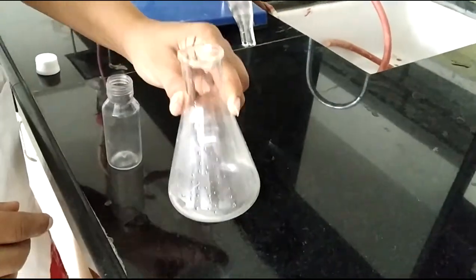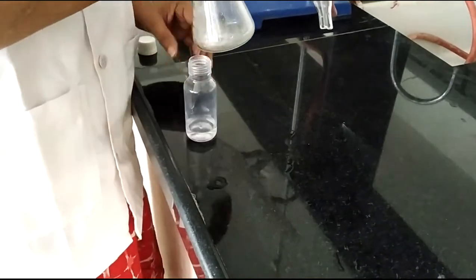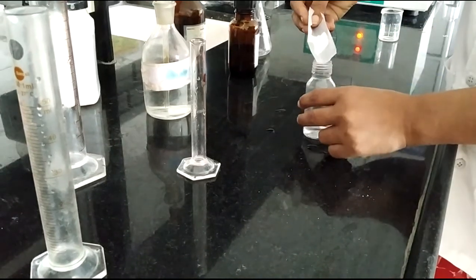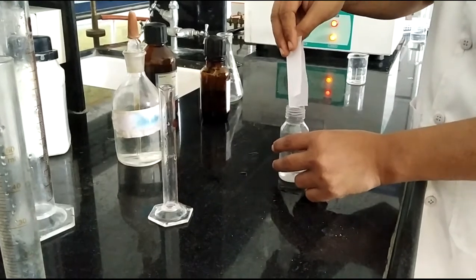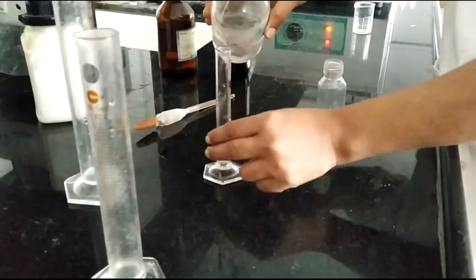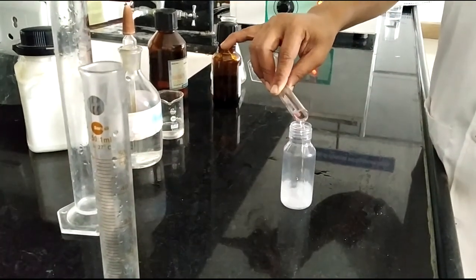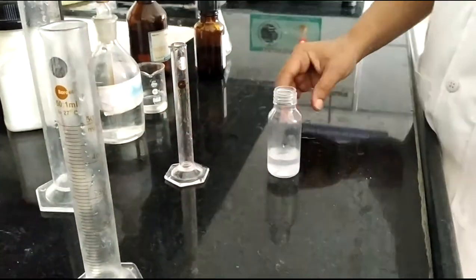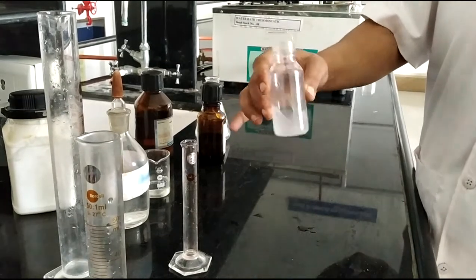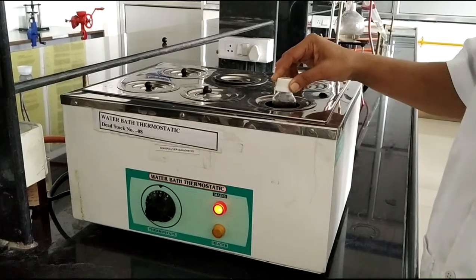Collect the second portion of the distillate — approximately 3.5 ml — and transfer it into a bottle. To this bottle, add 2.5 g of ammonium bicarbonate and 7 ml of strong ammonia solution. Close the bottle securely and place it in a water bath with continuous shaking until all the salt has completely dissolved.